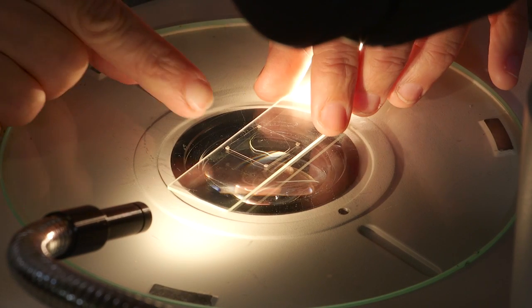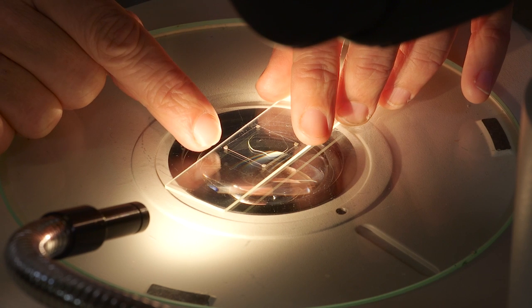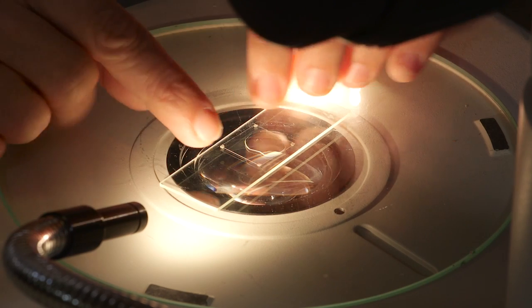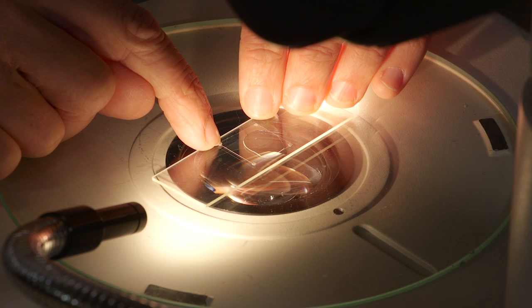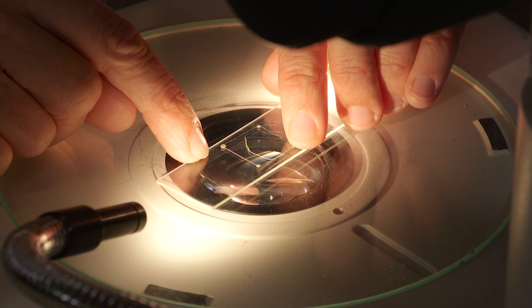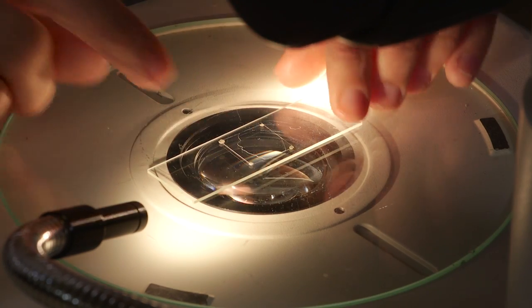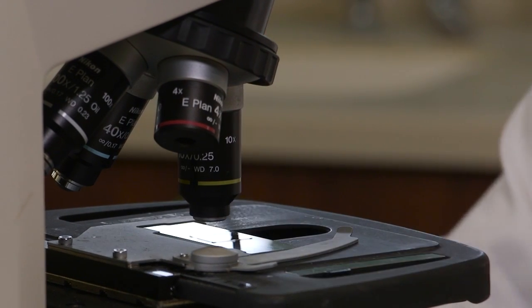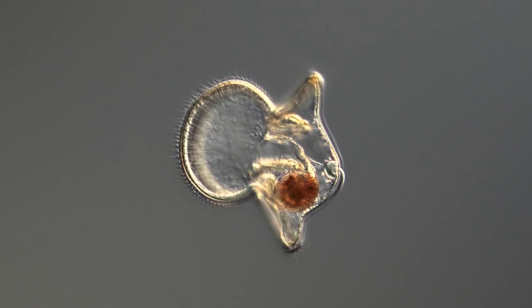You may need to compress the specimen just a little bit to trap it and prevent it from swimming. For this, put the slide back into the microscope and gently compress the clay at the corners while looking at it through the microscope to make sure you don't damage the specimen. Now you are ready to examine it under the compound microscope. Note the shape, color, and developmental stage of the larva and, if at all possible, photograph it.